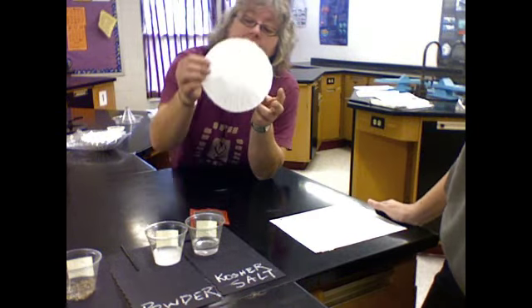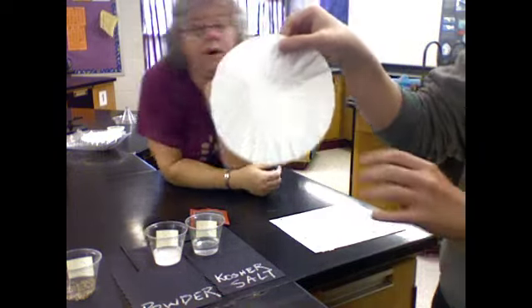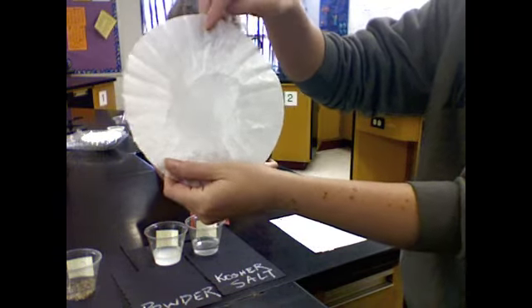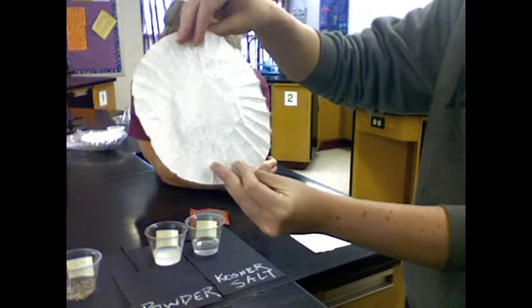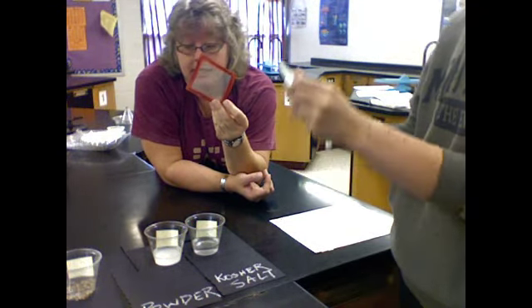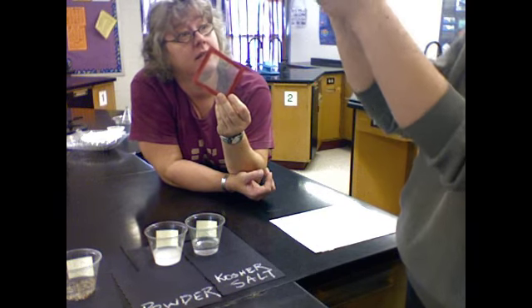And our second kind of filter is a paper filter. I don't know if you can see that from where you are, but when I hold it up to the light, I can see tiny little holes, places where more light seems to come out through it. So one difference between these two filters is the size of the holes. I can't see an individual hole, but I can see light through it, so I know there has to be holes in it.